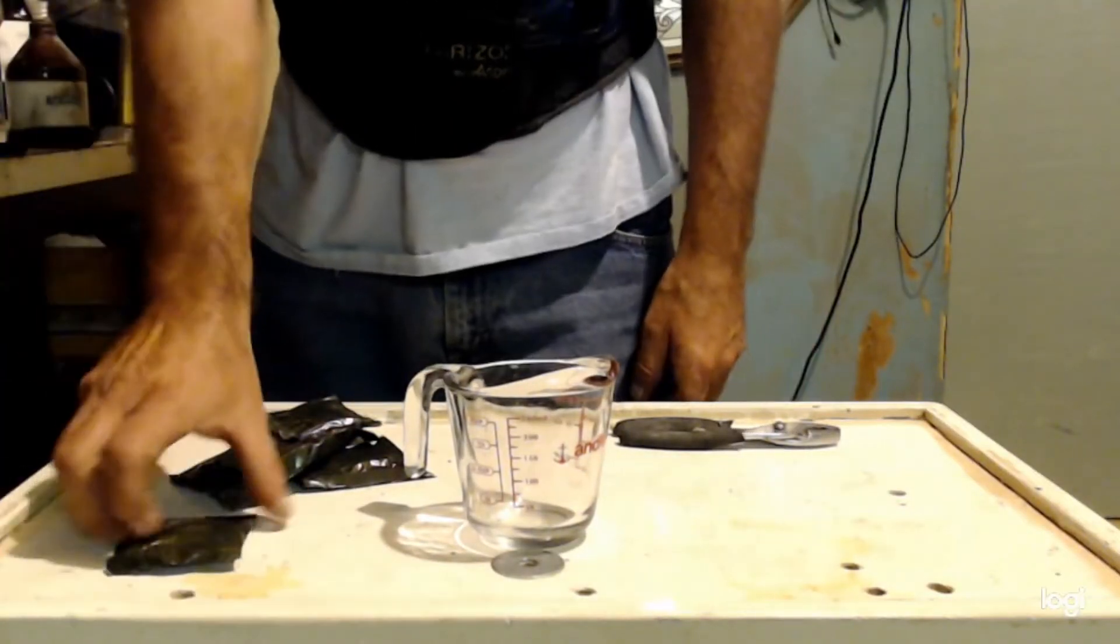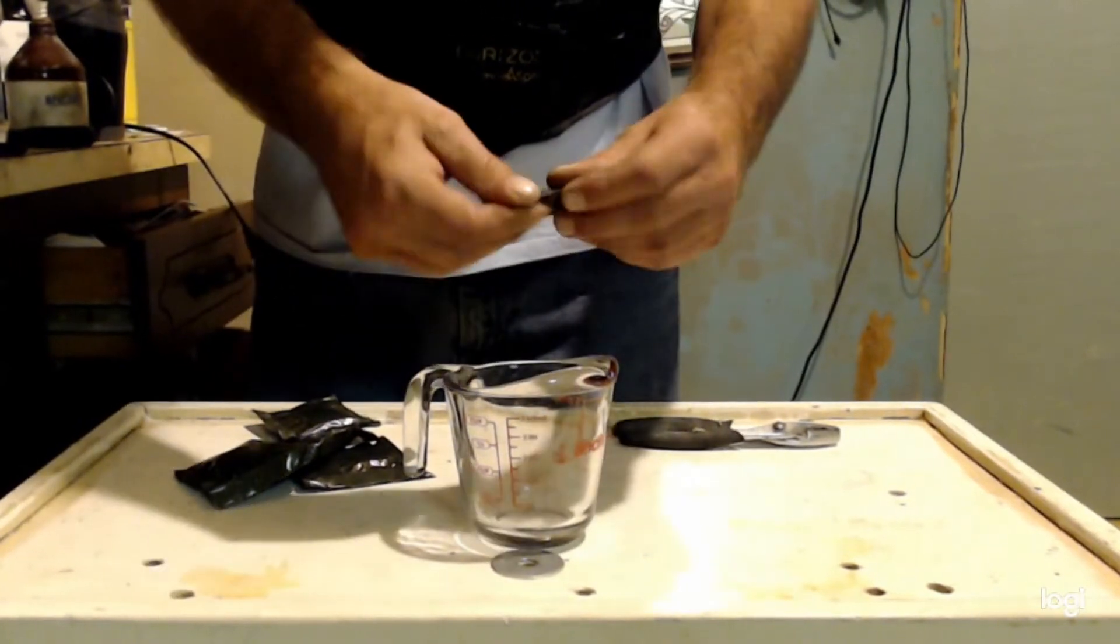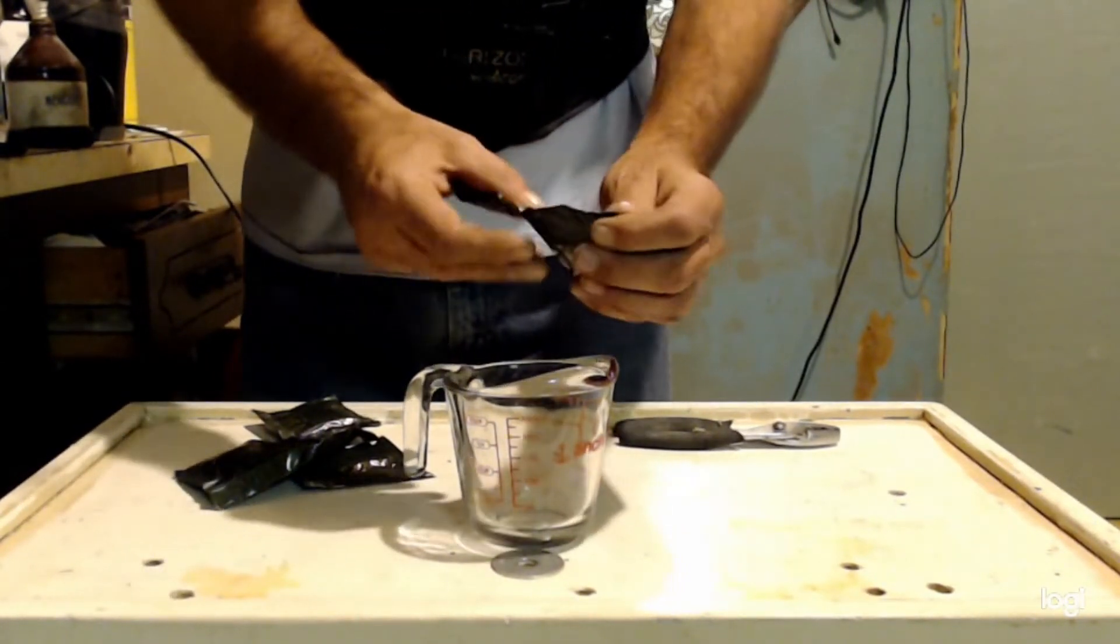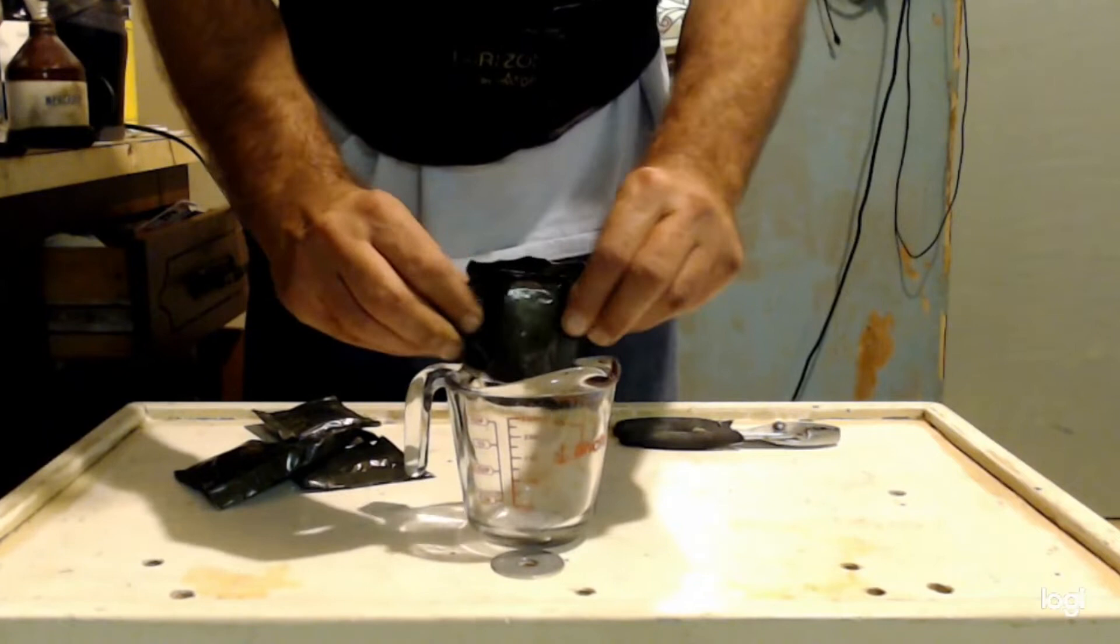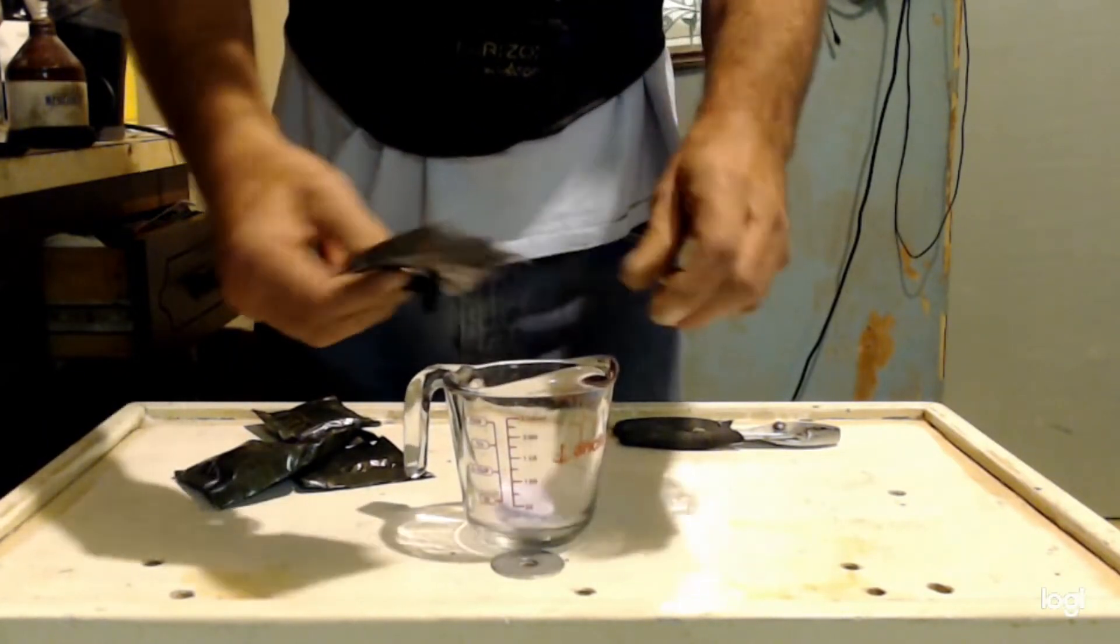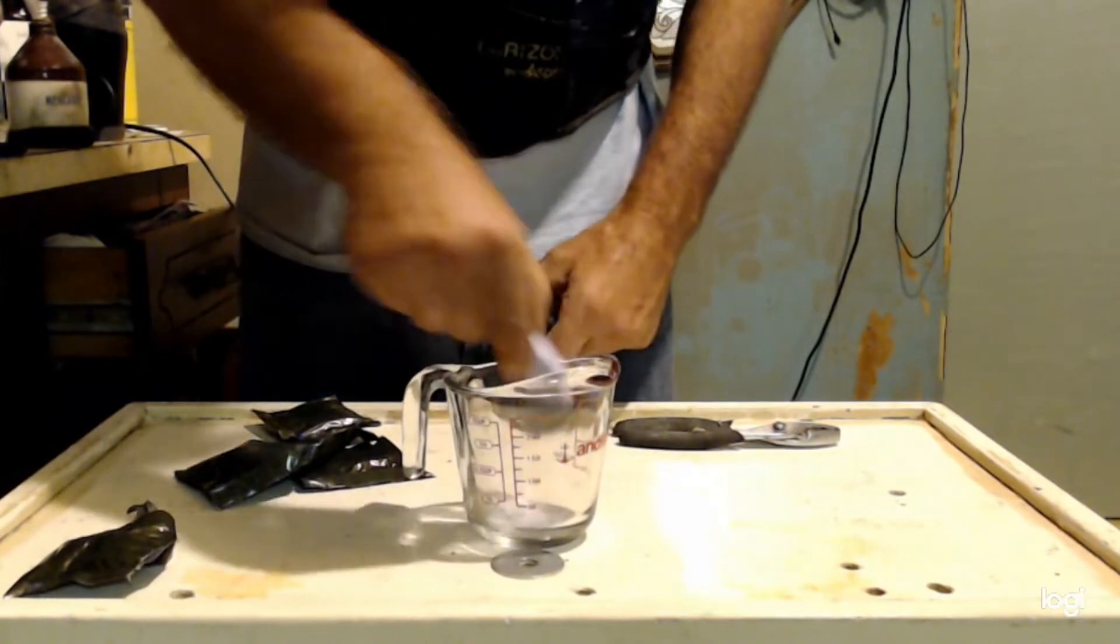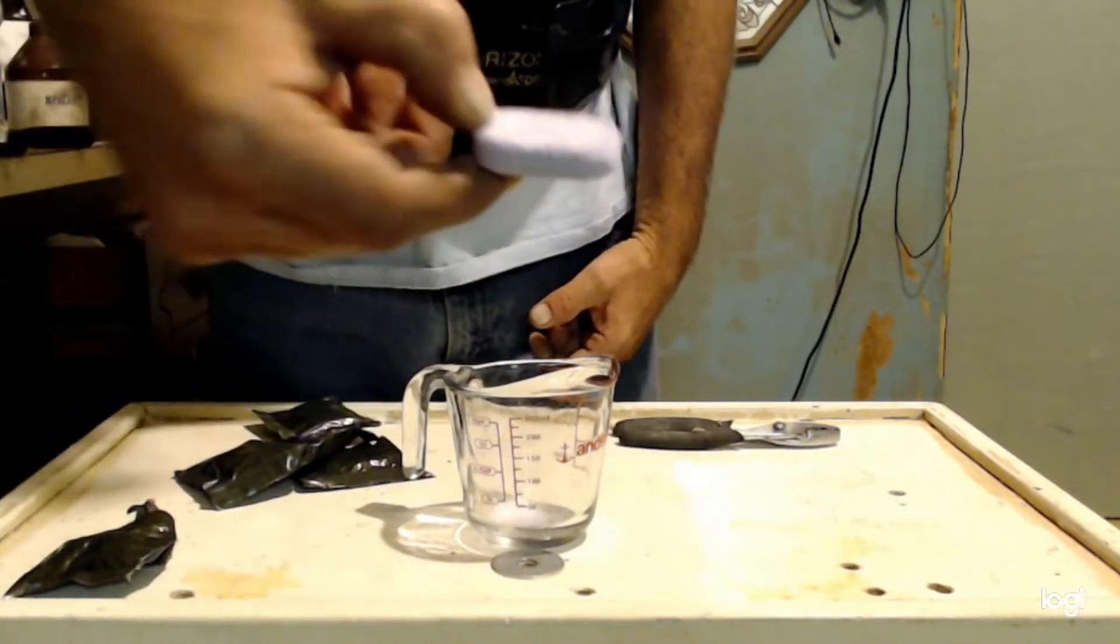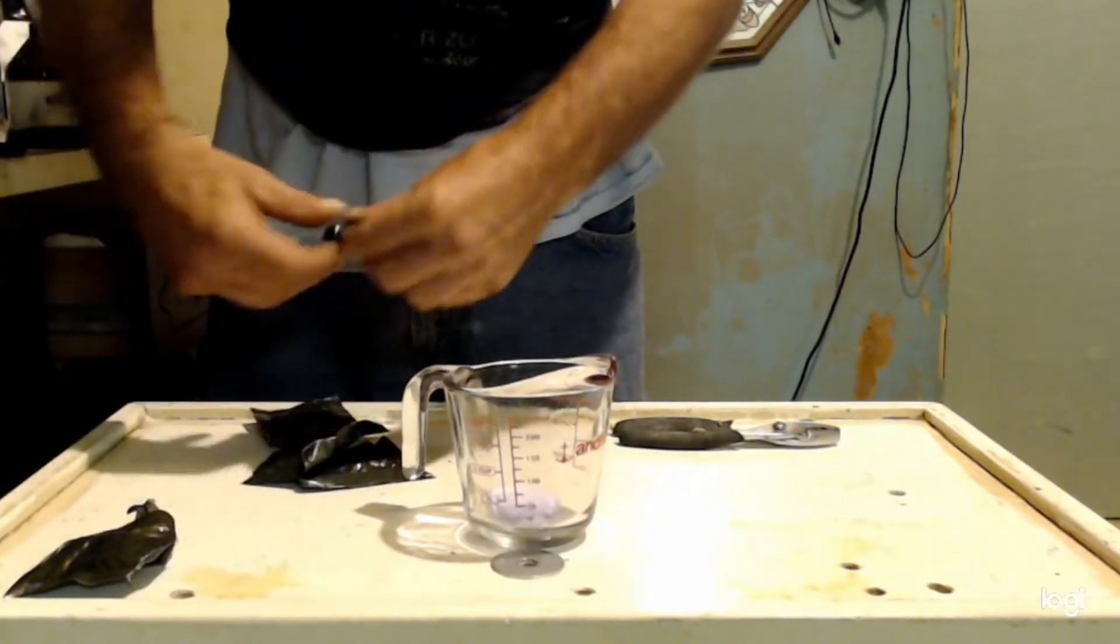So I bought some trioxane. What I'm going to do is open them up and dump them all into this cup. You can see it's just a bar, one bar per package.